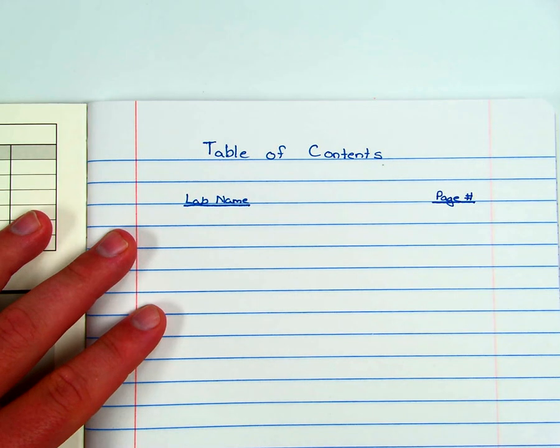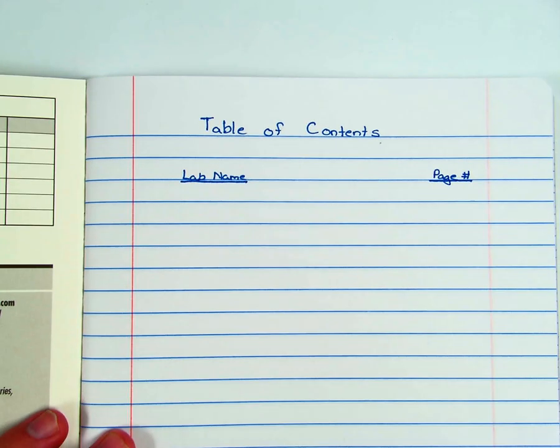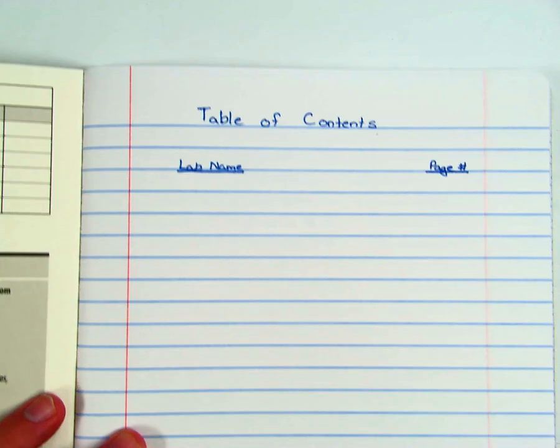So if you're going to put page numbers in here, that means you're going to need to physically go in and write in page numbers. I would prefer that you put them down in the bottom right hand corner. So I'm just going to slide this down here so you can see what I'm talking about. So down here in the bottom right hand corner, I'm just going to start by labeling this as page 1. You can circle it or not, it's kind of up to you.